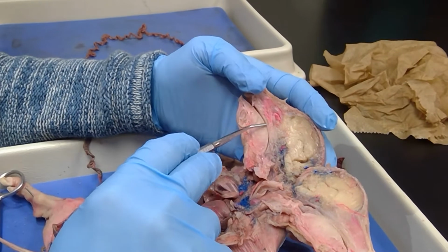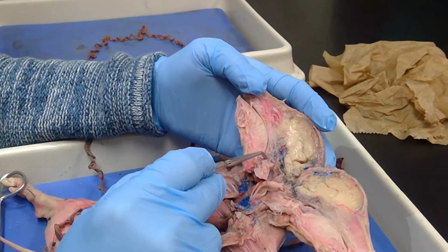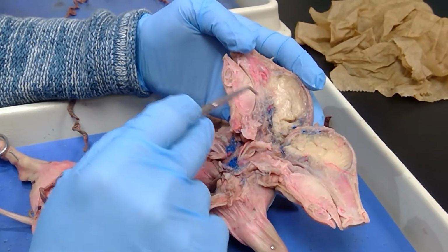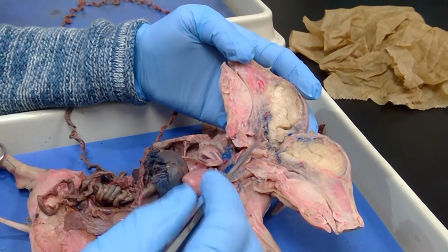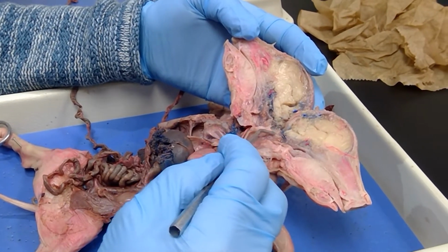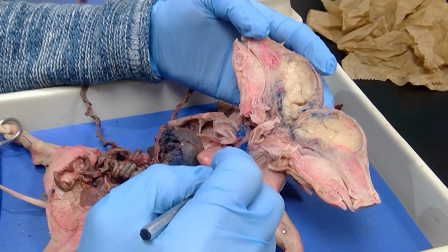So this is the hard palate here, and see where it gets soft there. That's the soft palate. So this right here would be the uvula. Would be somewhere there. There's the tongue. This one right here. The reason I cut the other one that we just went over is because I didn't think it was that great on the pharynx and stuff. This right here is the pharynx. See how it's all like messed up and everything.